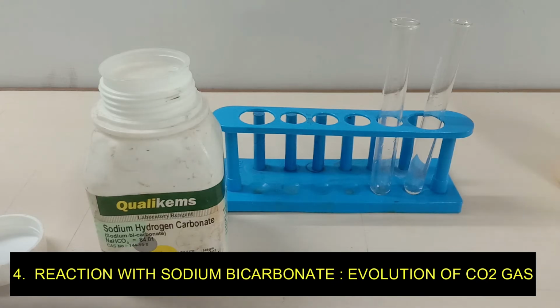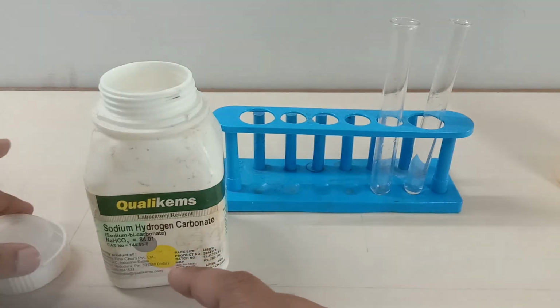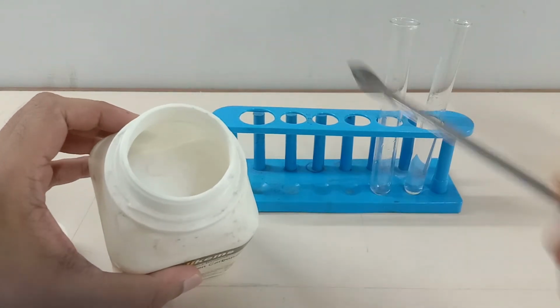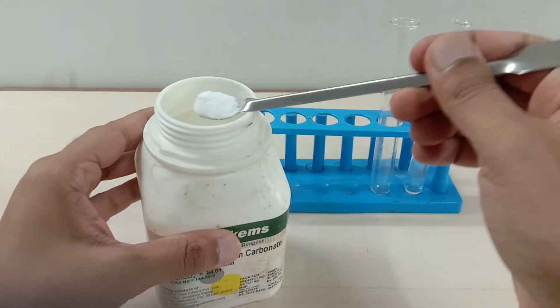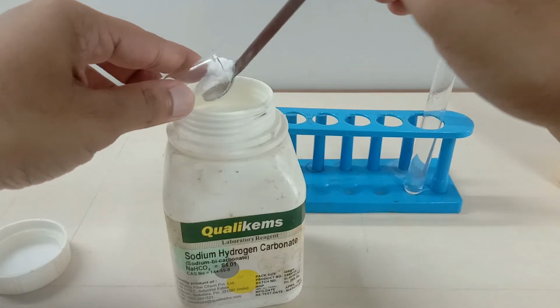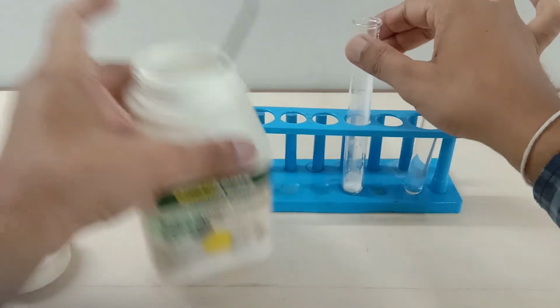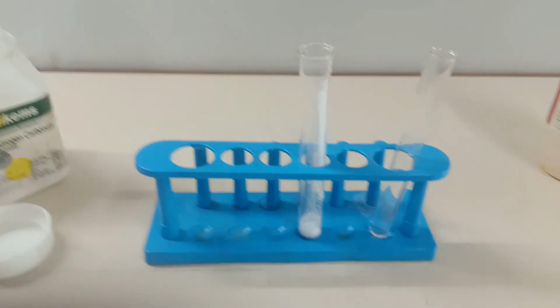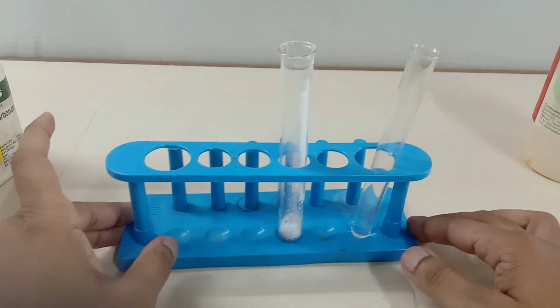So the last part, guys, we are going to add the sodium bicarbonate, which is a white powder, and sodium bicarbonate is soluble in water. So we are going to take some amount of sodium bicarbonate and add it into a test tube. Now we'll be adding the ethanoic acid into it, and as per the chemical reaction displayed over here, we would expect carbon dioxide gas to come out.